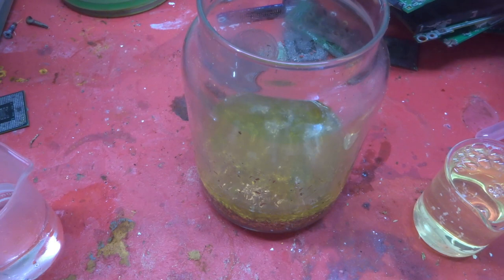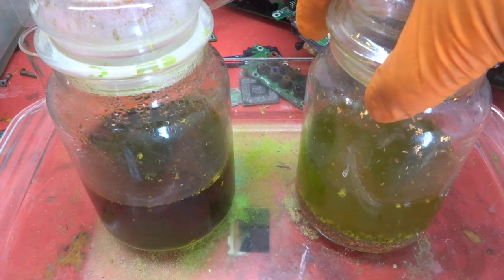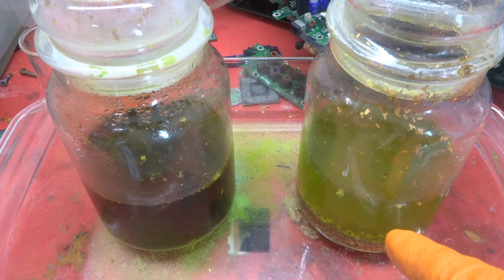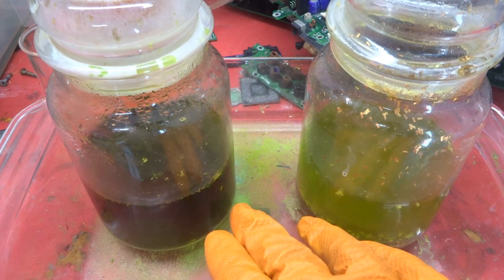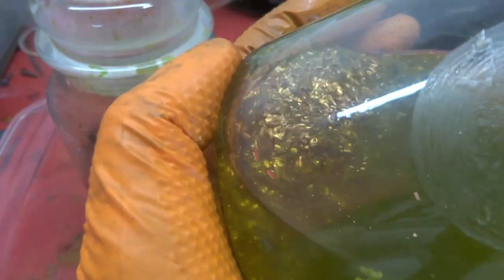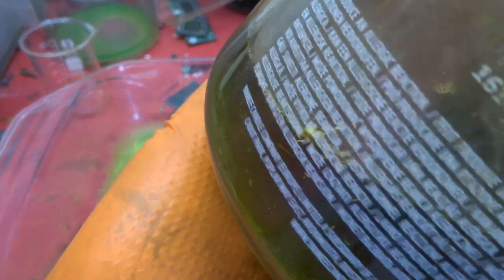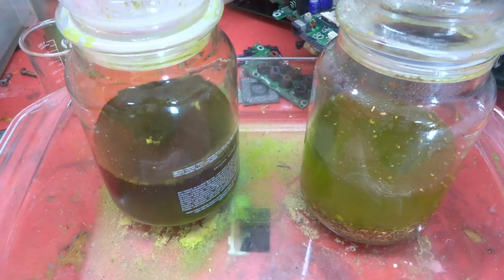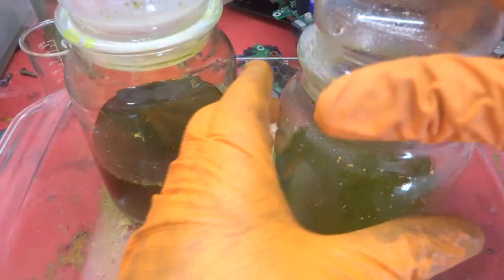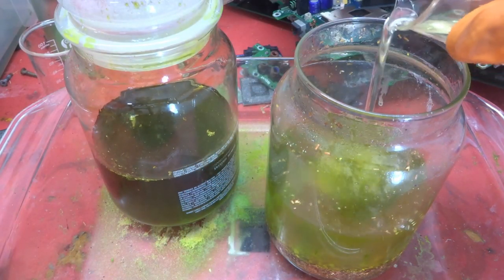This is 24 hours after I added the bleach. I've also got one beside it where I used nitric acid — two batches to compare. As you can see, in the bleach one after 24 hours we still have a lot of foils remaining. In the nitric one, there are far fewer foils — it has really dissolved a lot of them. That tells me straight away that nitric is going to be a lot quicker for this job.